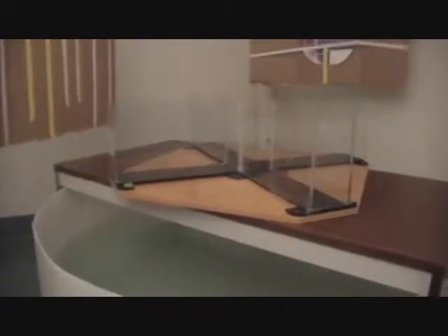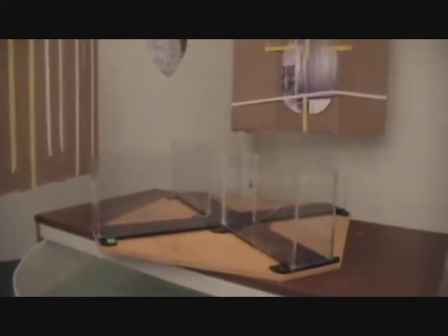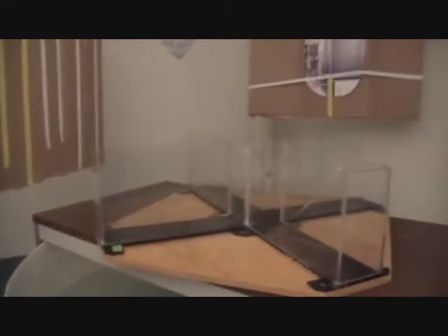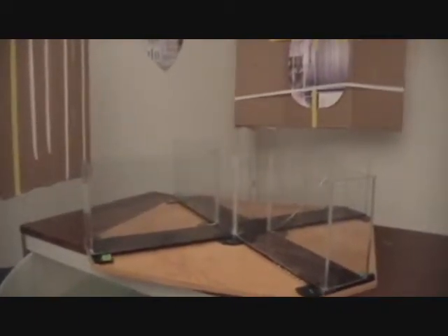This is what our plus maze looks like. You can see we have a water maze underneath and a table straddled across the top of the water maze, and our plus maze sits on top. Now this plus maze is totally enclosed. You can see it has the plexiglass walls that enclose all four arms. So it's not the standard elevated plus maze to test anxiety.